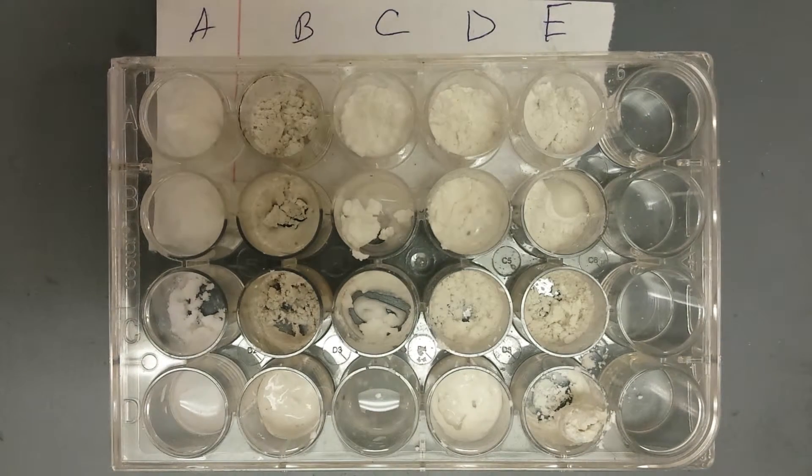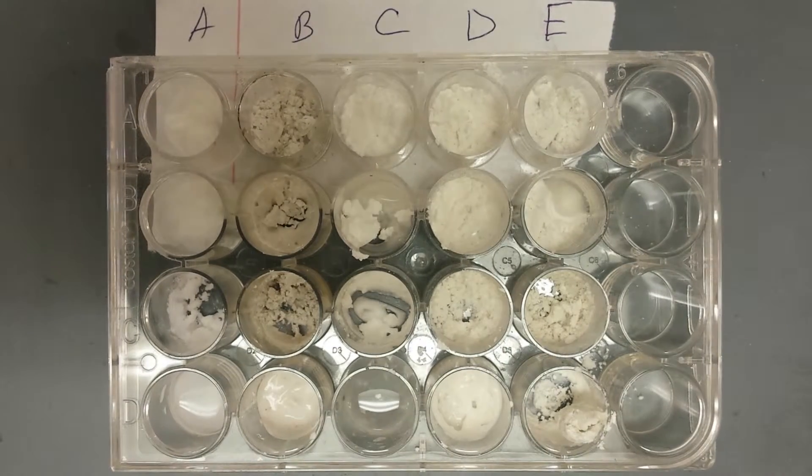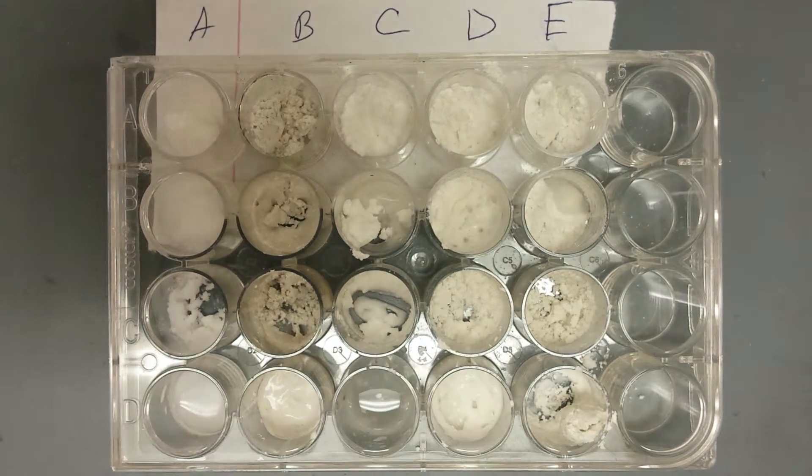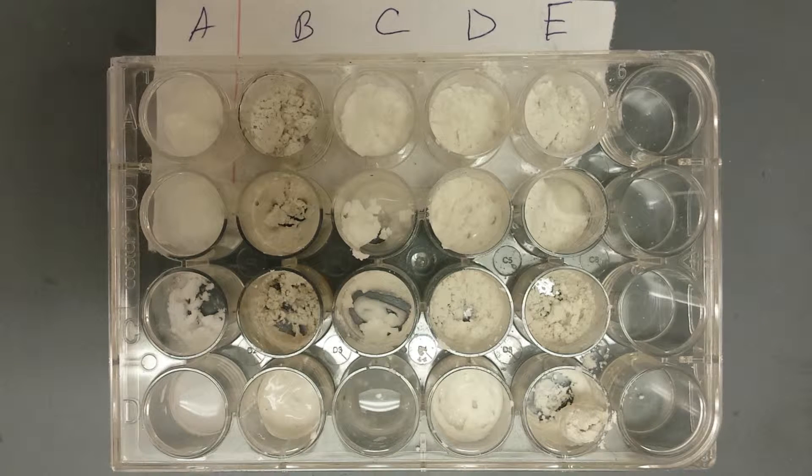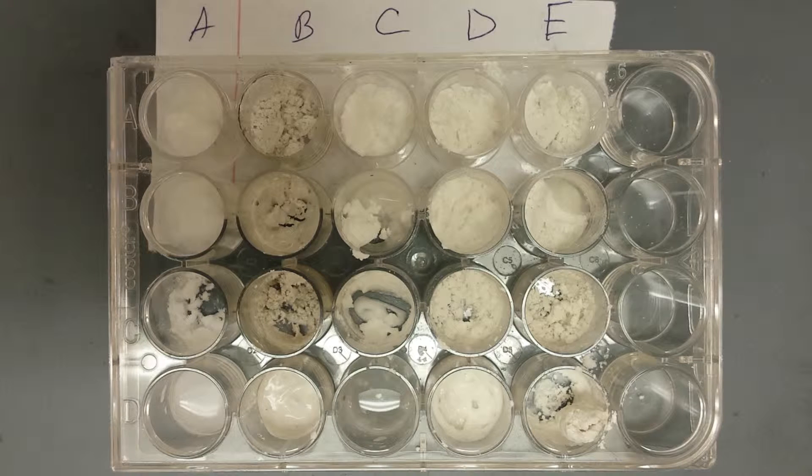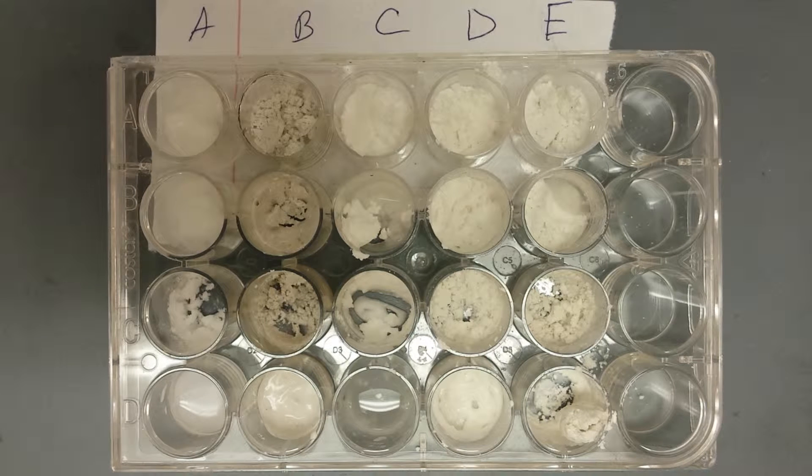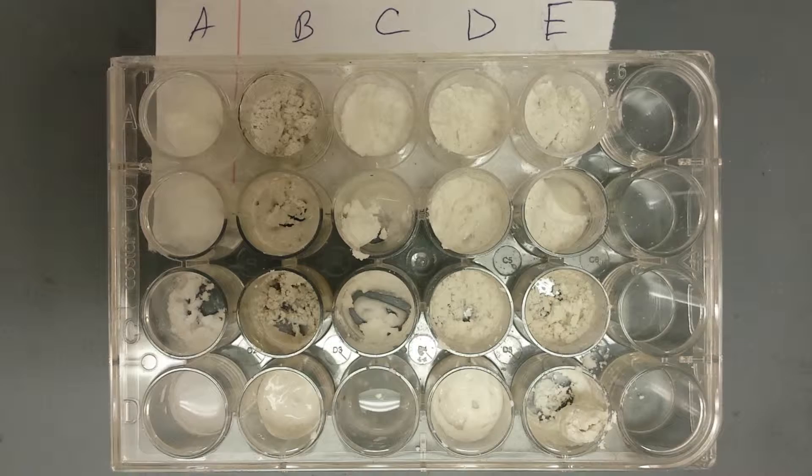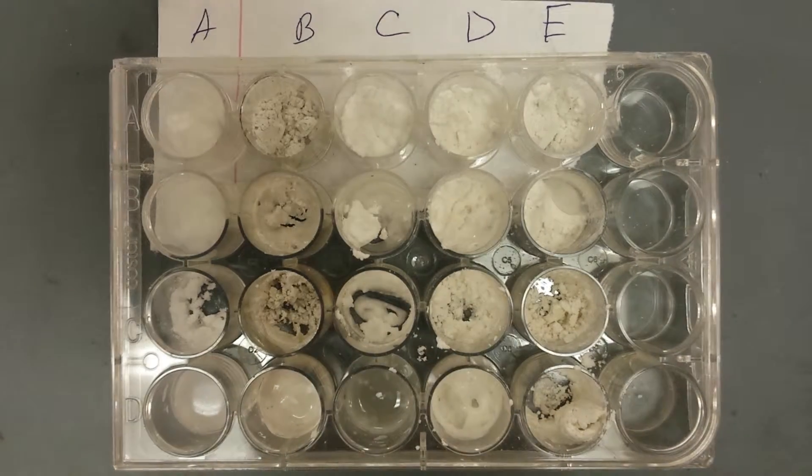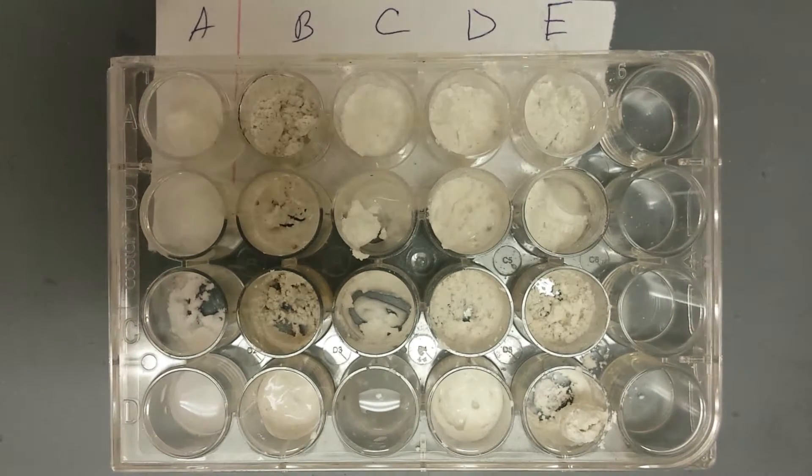Okay, so what was it? A and D fizzes, and B fizzed a little. A and D fizzed a lot, and B fizzed a little. A and D fizzed a lot. And D also fizzed a lot. Okay, and then what was the other one? B fizzed a little, a bit of B.